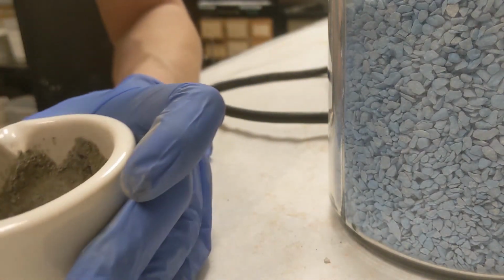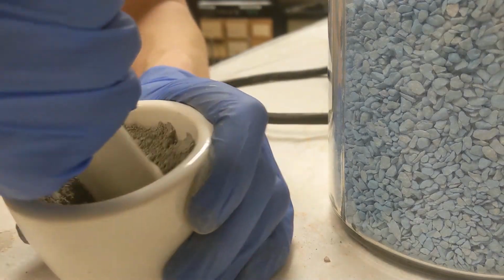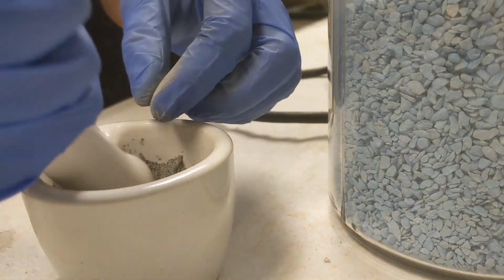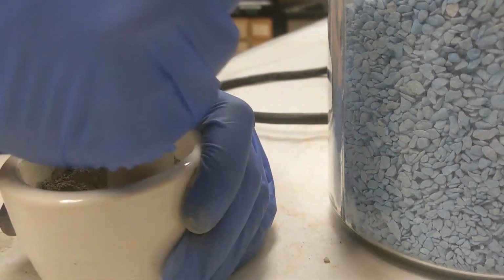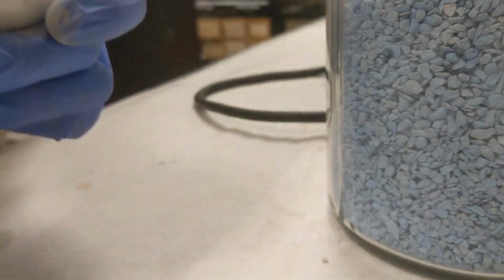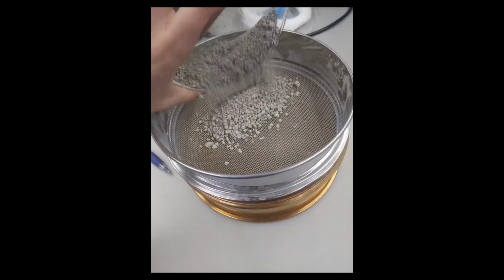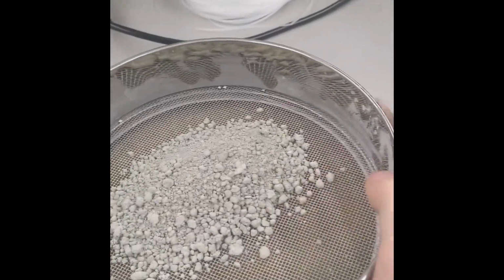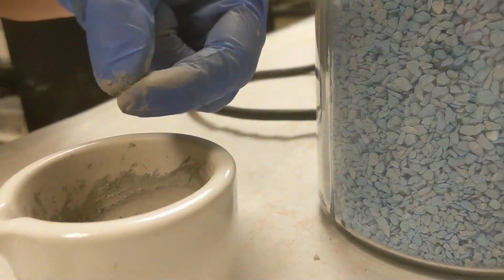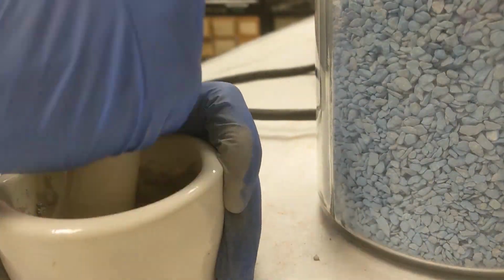It doesn't really even look silvery, which is kind of sad. Like, after all that work, you'd expect the result to at least be beautiful. But silver isn't really that beautiful, which makes me wonder why I'm doing this. So the big mistake I made was trying to grind it before it was completely dry. Because what I found out after basically hours of grinding and sifting and grinding and sifting was it's not the fact that they're actually lumpy, it's the water making it lumpy. So just a word of advice, make sure it is completely baked 100% dry before you try to grind it down, because it's pretty much already a powder. It's just the water keeping it all lumpy.